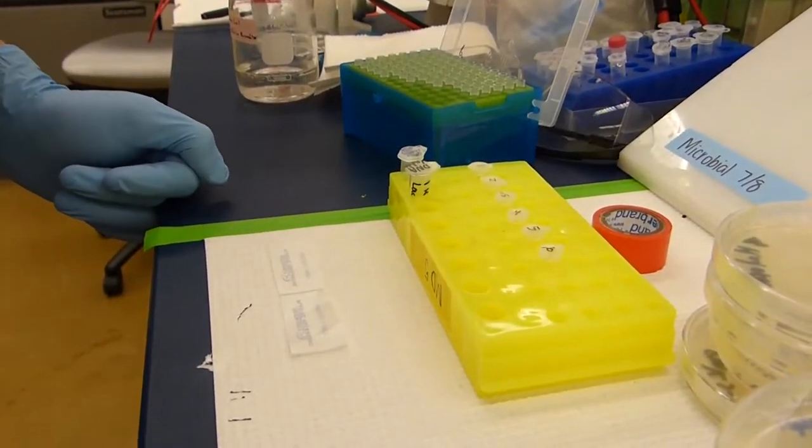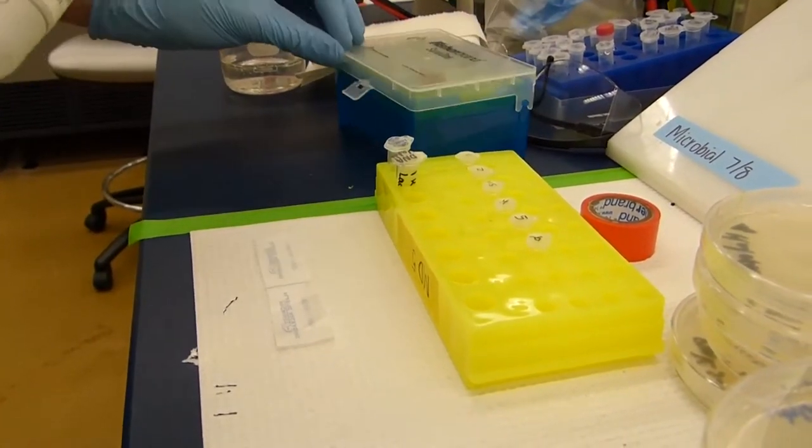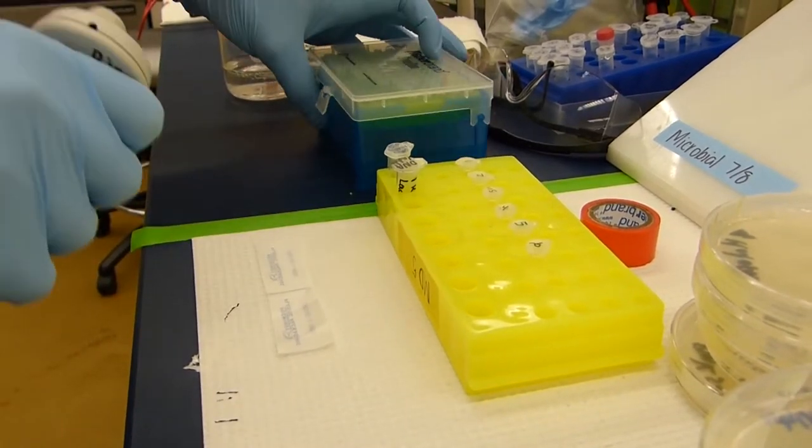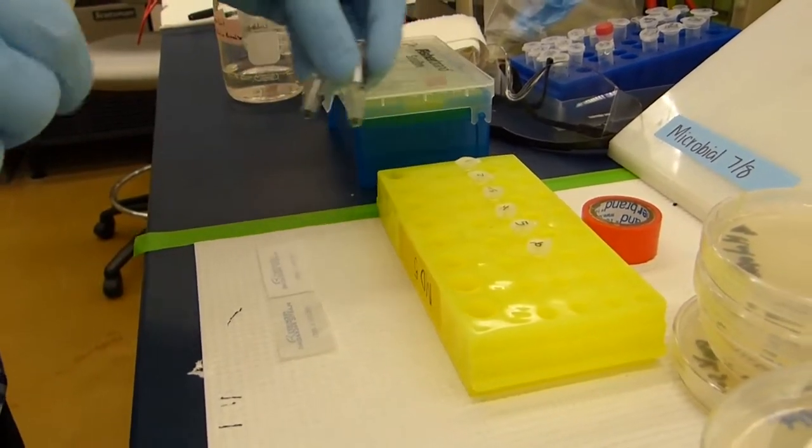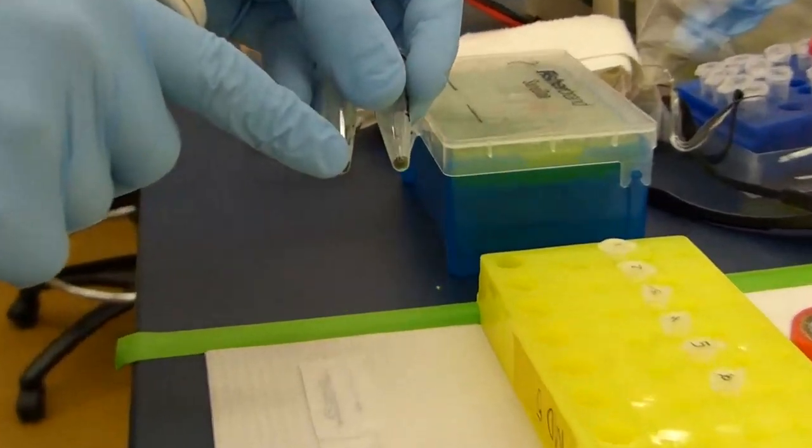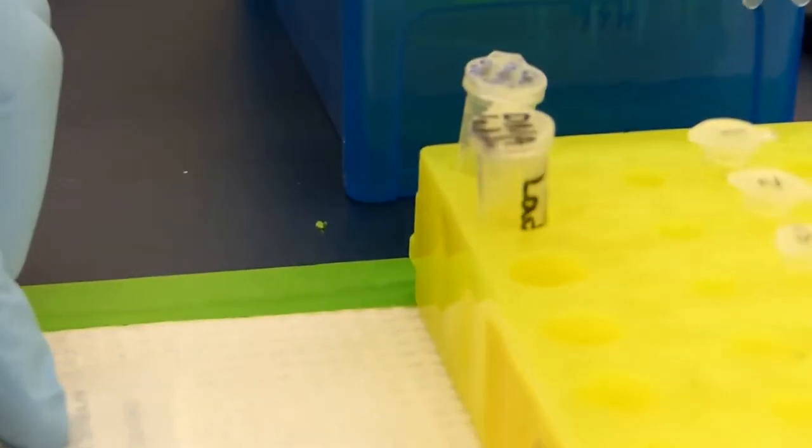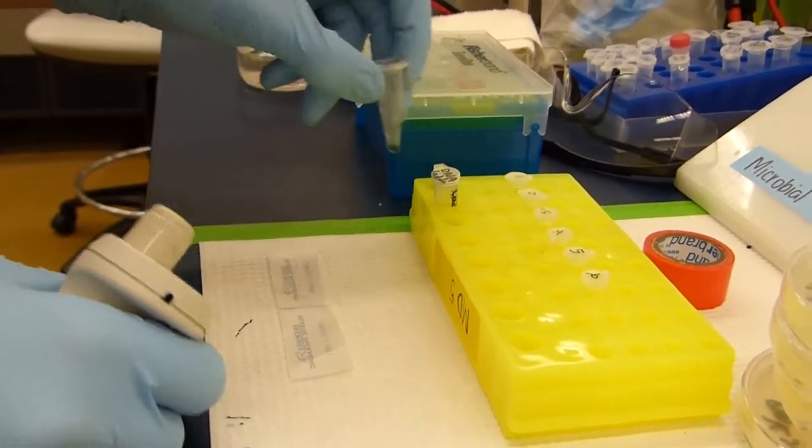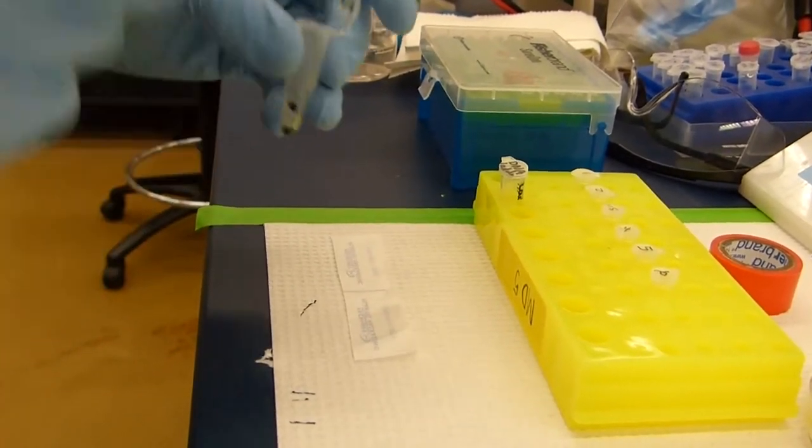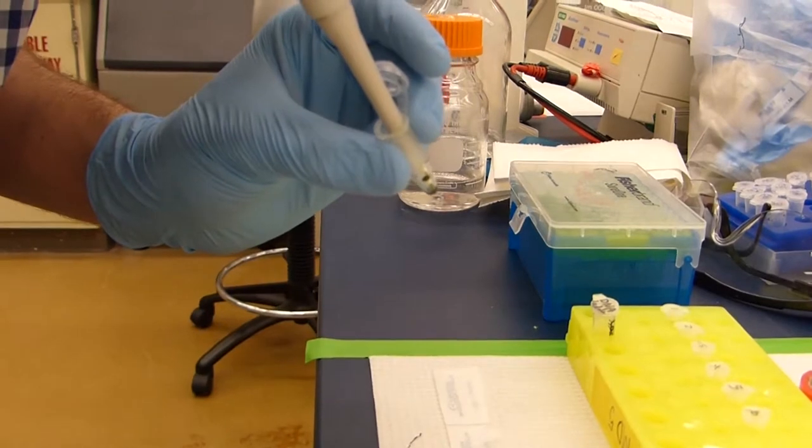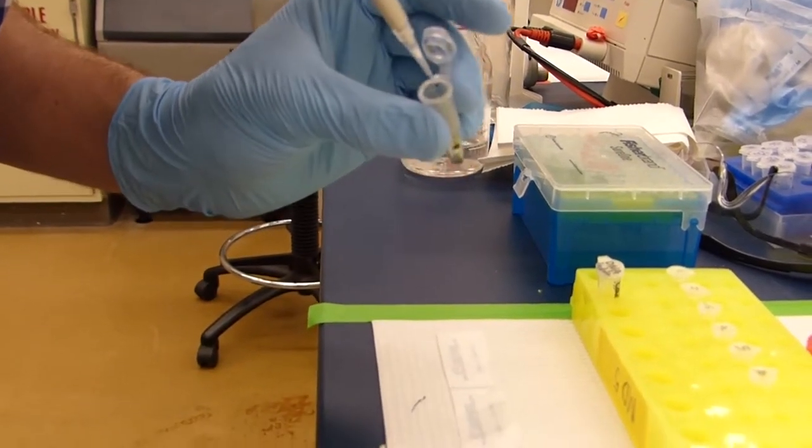When you are ready to prepare your sample, you will need a small pipette size pipetter, a box of small pipettes, the 6X loading dye and DNA ladder from the freezer. Be careful not to confuse them as they are both green and you may need to thaw them a bit first. A strip of parafilm and your samples. What you want to do for this process is to set the pipetter to 3 microliters and get about 3 microliters of the loading dye.